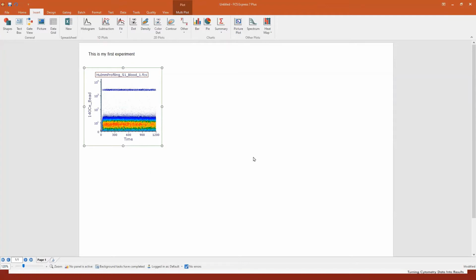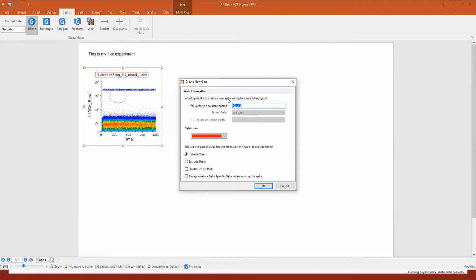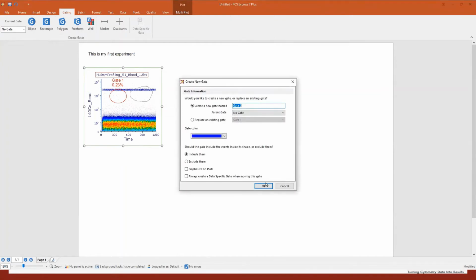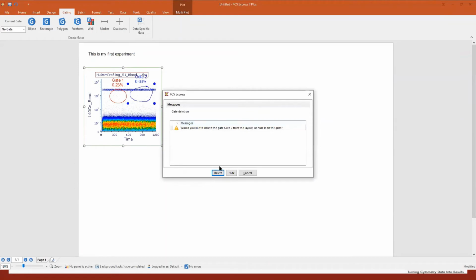In this case, I'm super happy to show you how to create the first gate. So just go to the gating tab. You see we have a bunch of gates here. Just to show you, if you want to draw an ellipse, just click on ellipse. It's very simple, and then type the name. If you want a freeform gate, draw a freeform gate and type the name. You can also change the color. Whenever you want to delete a gate, simply press delete on your keyboard and you will be able to delete it.